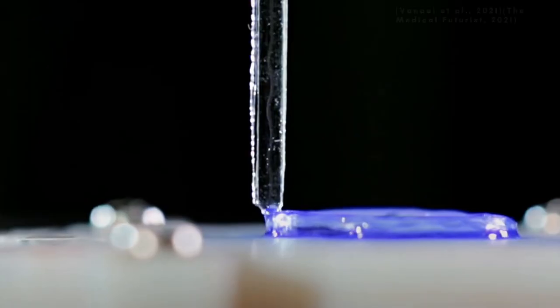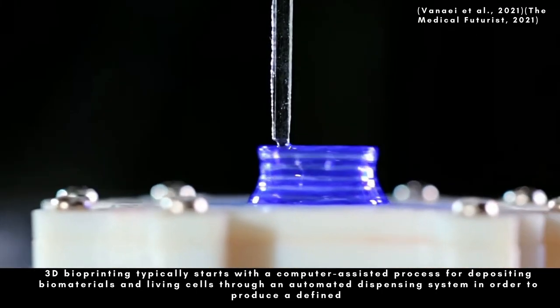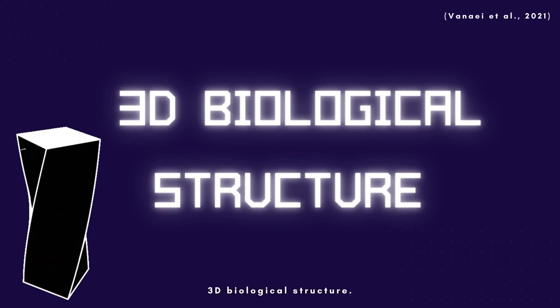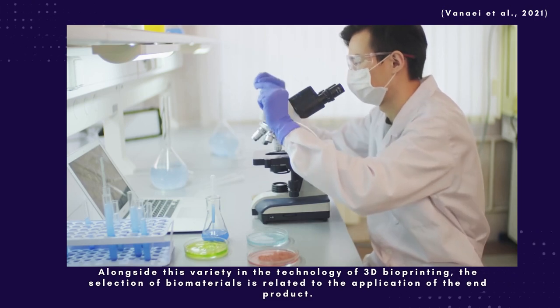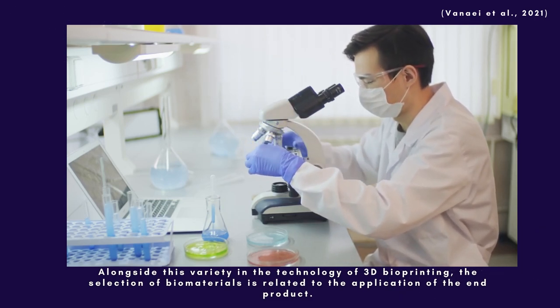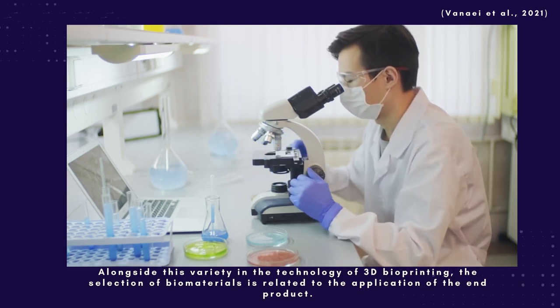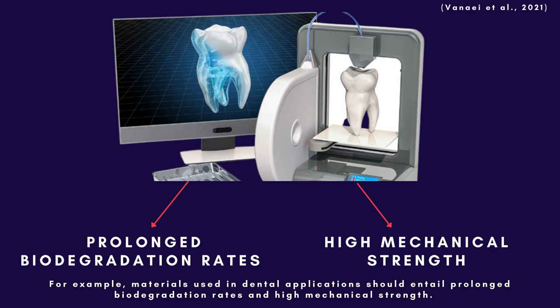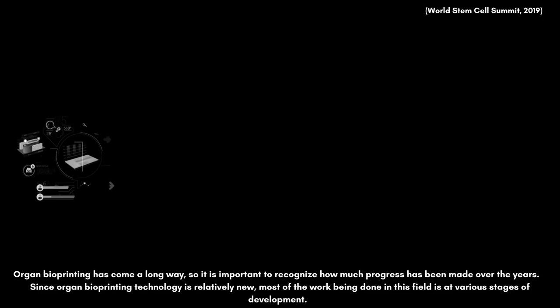3D bioprinting typically starts with a computer-assisted process for depositing biomaterials and living cells through an automated dispensing system, in order to produce a defined 3D biological structure. Different techniques are used to engineer different structures. Alongside this variety in the technology of 3D bioprinting, the selection of biomaterials is related to the application of the end product. For example, materials used in dental applications should entail prolonged biodegradation rates and high mechanical strength.